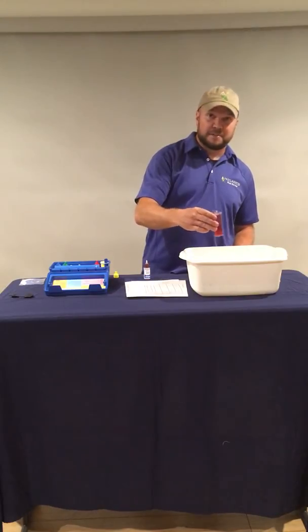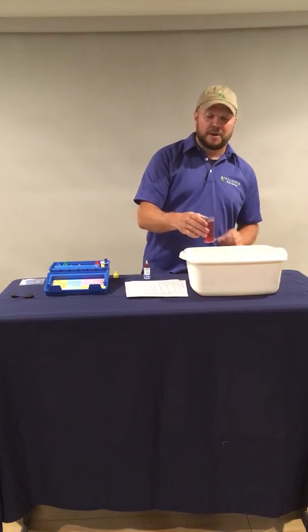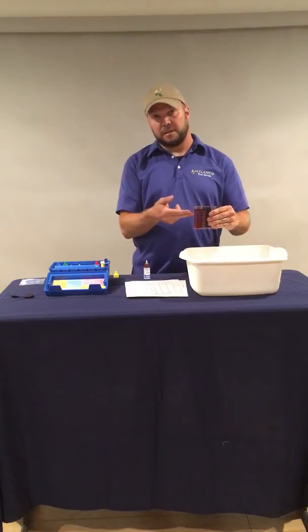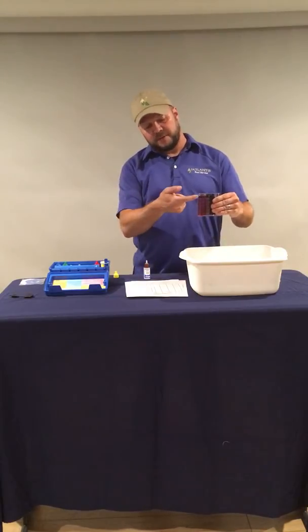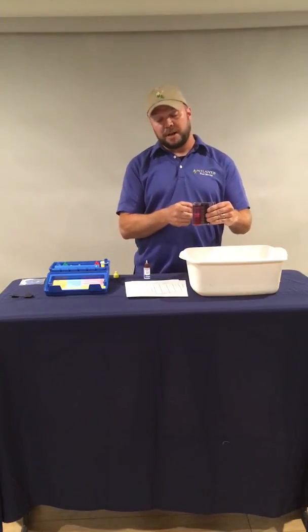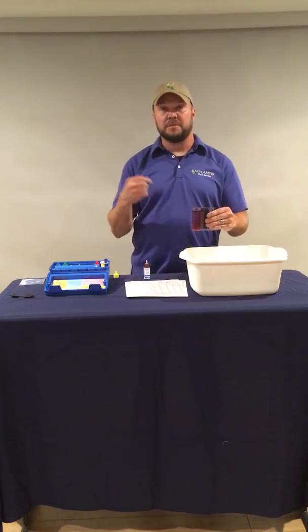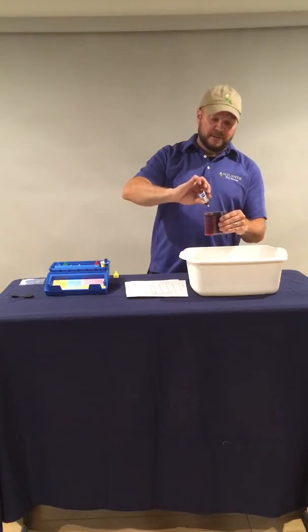So with just that little splash of bleach, this is pretty high. We're already at 10 drops. And what we're going to do to calculate this is, when this turns clear, we're going to multiply the number of drops that we've added by 0.2 because we filled it to the upper line. So it's at a 0.2 increment. So 10 drops times 0.2, we're at 2 parts per million right now. 0.2 times 10, 2 parts per million, and we still haven't changed yet. So if this was an indoor pool, we'd already be over.